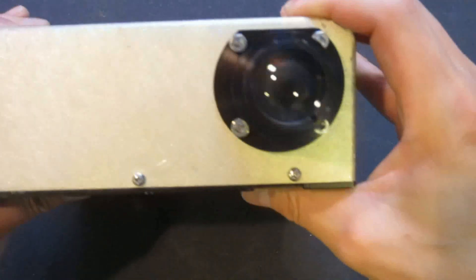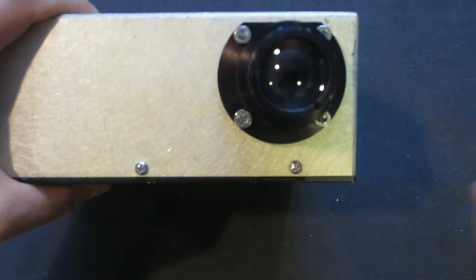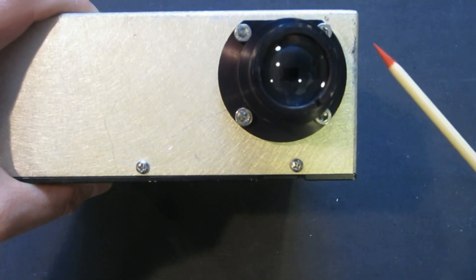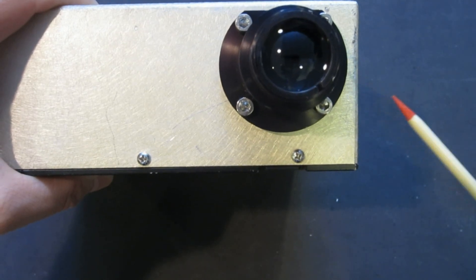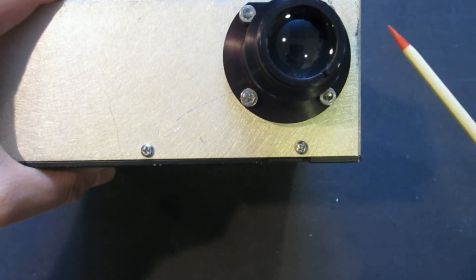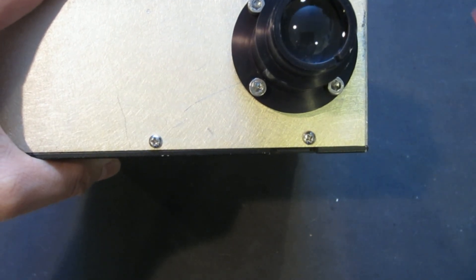Unfortunately, after my initial inspection, I found out that this one, for whatever reason, does not have an optical slit inside. I'm not sure what the reason was and it doesn't look like it was damaged or anything like that. It just simply has a round hole in the middle.